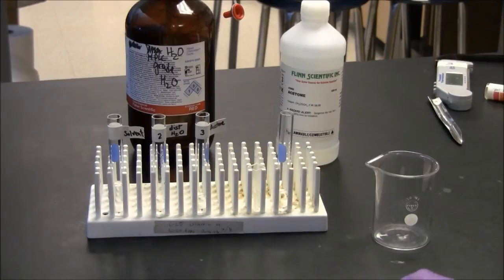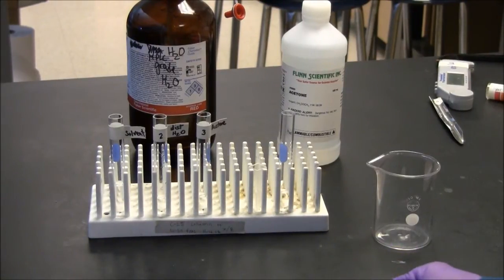It is essential that you clean your syringe, otherwise its lifespan will be very short.